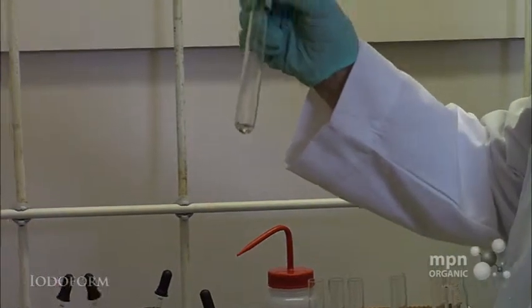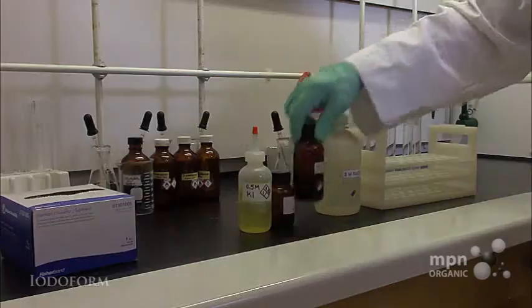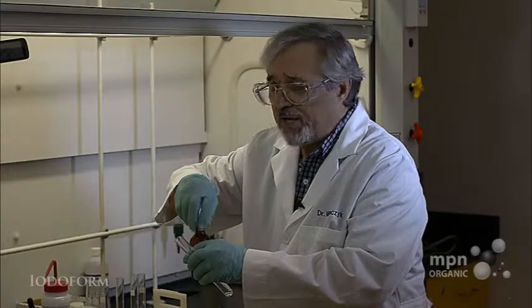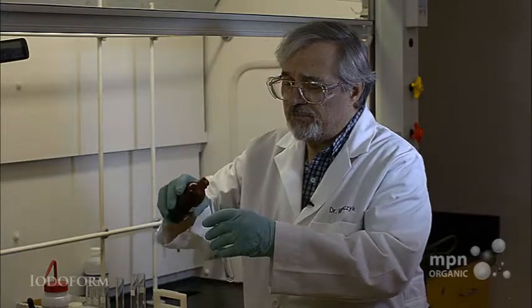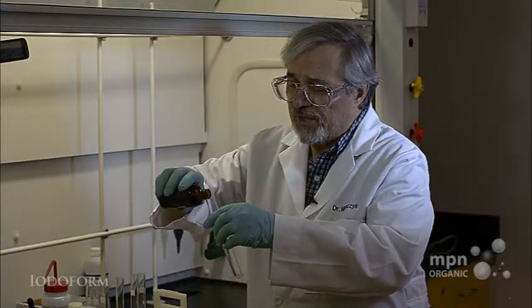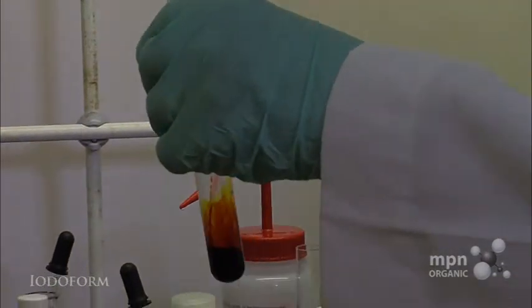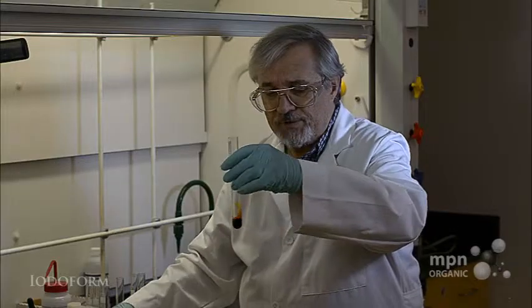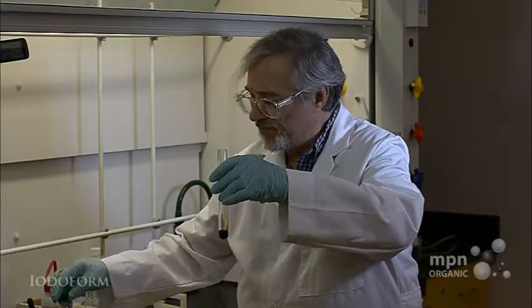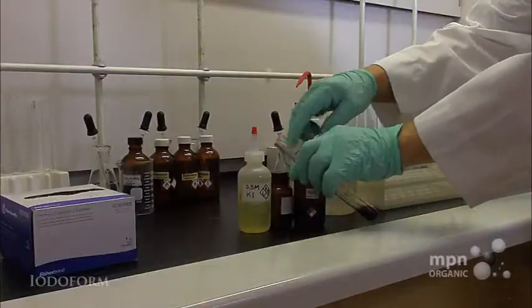There's some acetone in there, and I'm going to add my potassium iodide iodine solution — you'll see that it's a very dark orange-brown. There it is. And let's close that up.